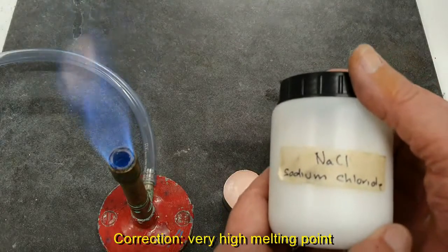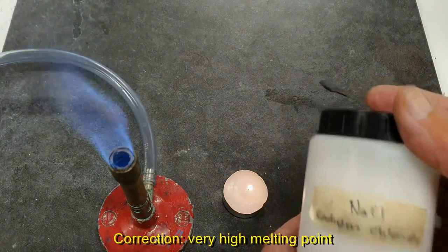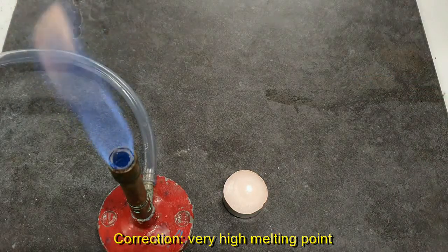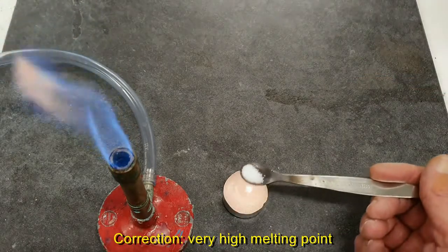The next one for us to have a look at is the sodium chloride, our table salt. So we'll have a look at its melting point. First of all, into the candle flame.